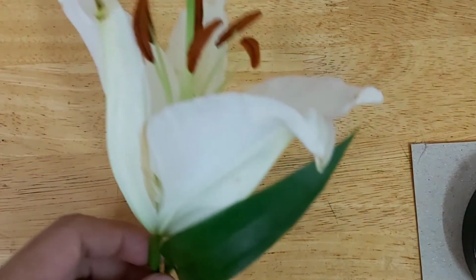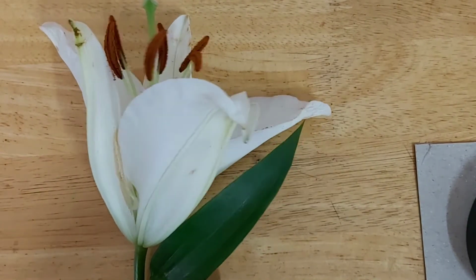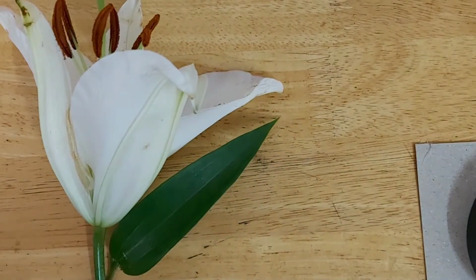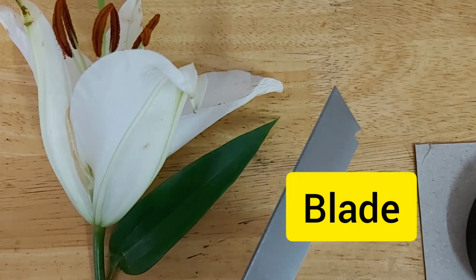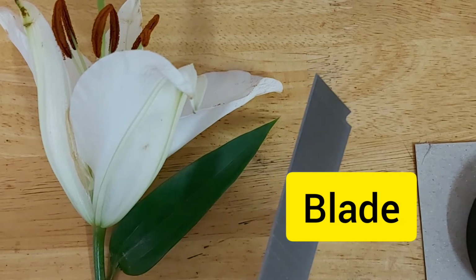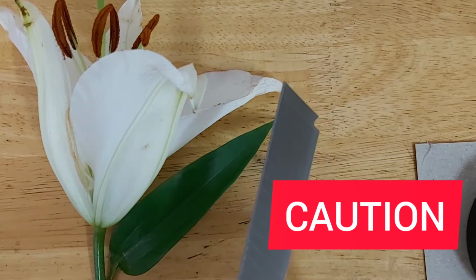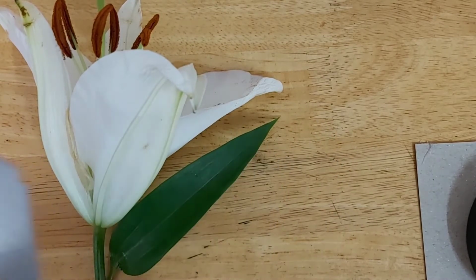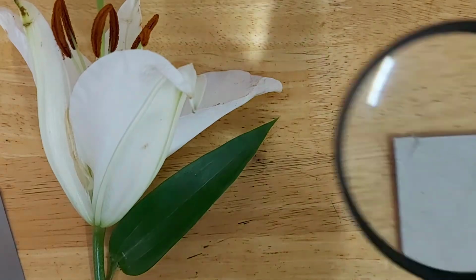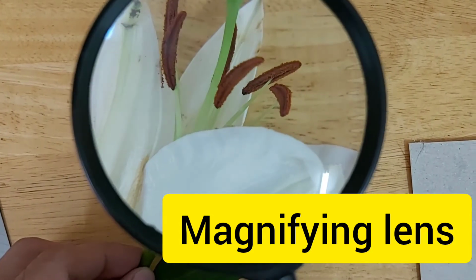The first is we need a flower, of course. The flower that we are going to use is a lily. So this is a lily. And then we're going to use a sharp knife. So here I have a blade, a blade of a cutter. Now always remember, when you are using any sharp object, you should use it with care, and there should be the supervision of an adult or of your parents. And then we are going to use a magnifying lens, also known as the magnifying glass.